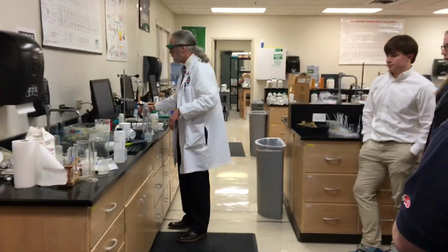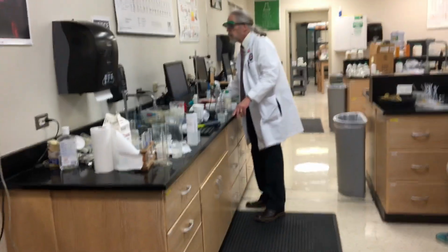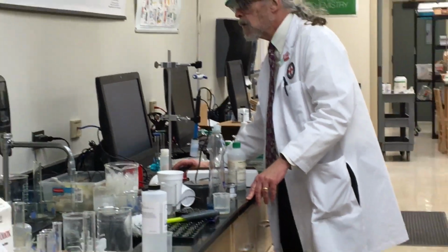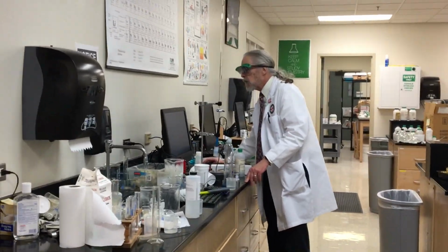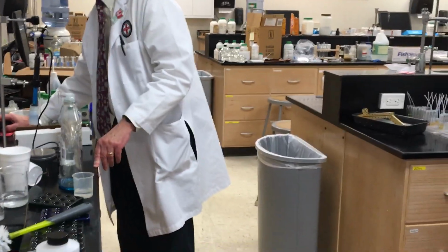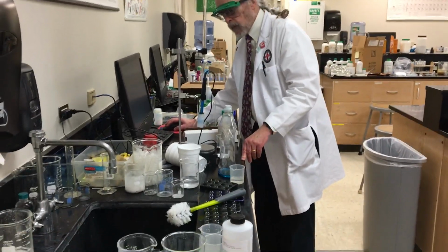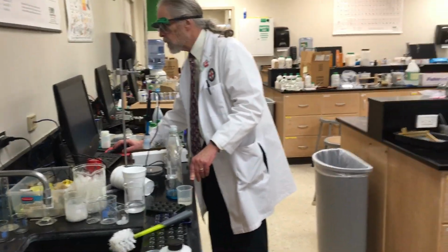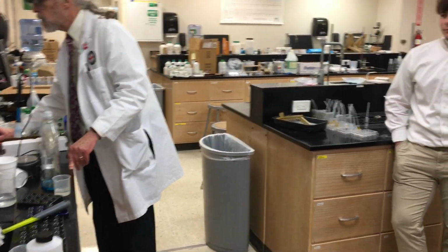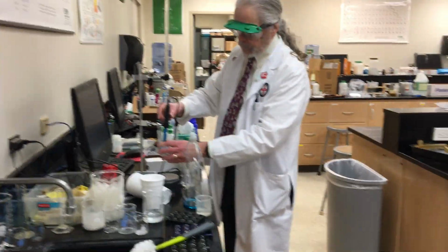Doing this right now. I'm going to say experiment. You want to move forward? Calibrate. Yeah, that'll work. I'm not sure what's going on. All right. Look at this.